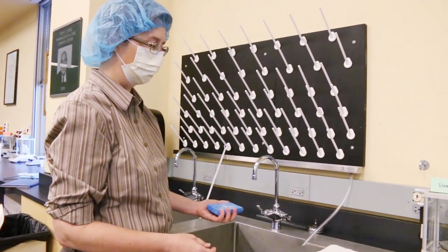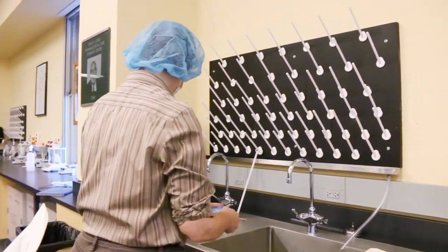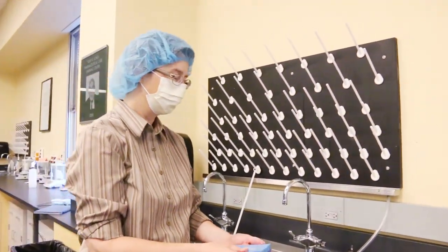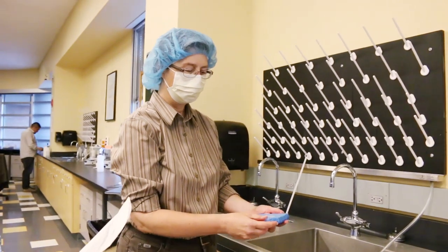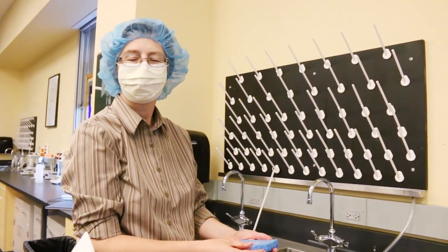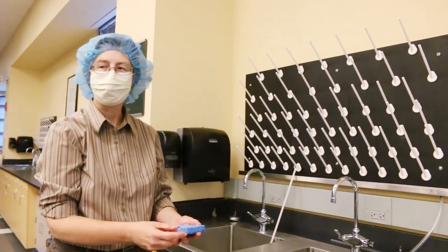Use the other hand to dispose of the wrapper in the waste container. You press foot pedals to operate the sink if foot pedals are available. If no foot pedals are available, please ask the judge to turn on the water for you. Will you please turn on the water for me?